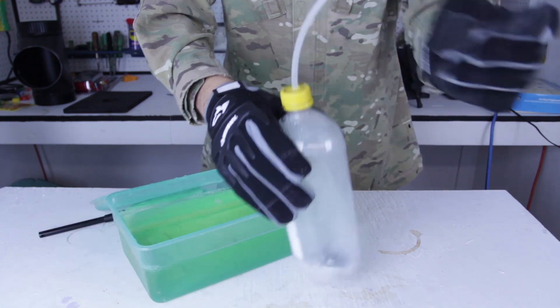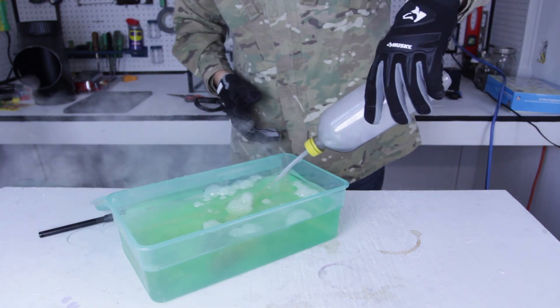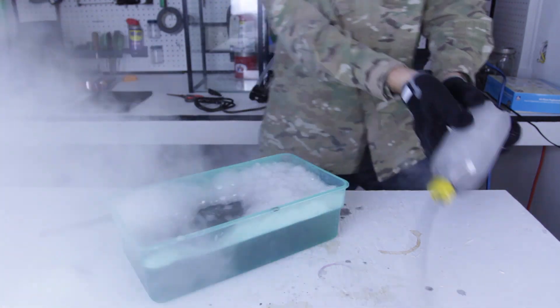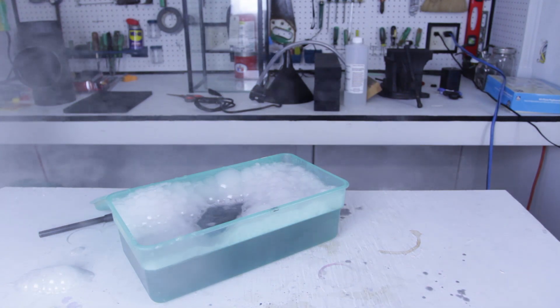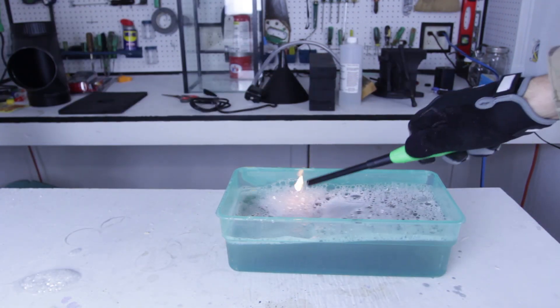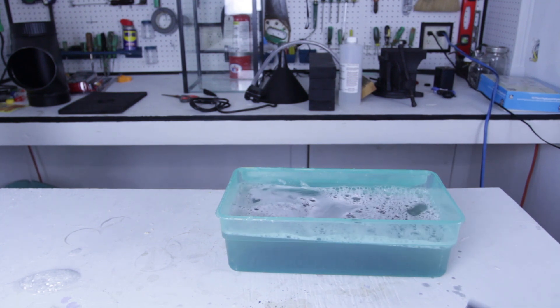Okay, here you go. Now I'm going to put it under water. Now let's try to set it on fire. Ooh, do you hear the explosion?